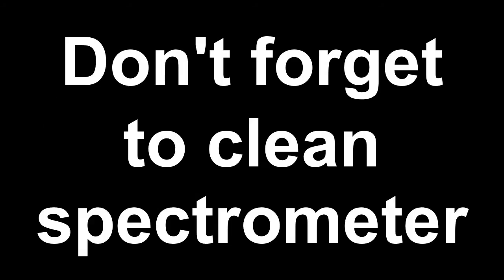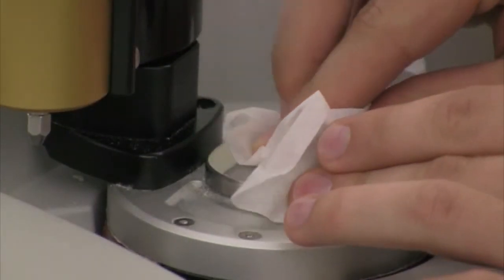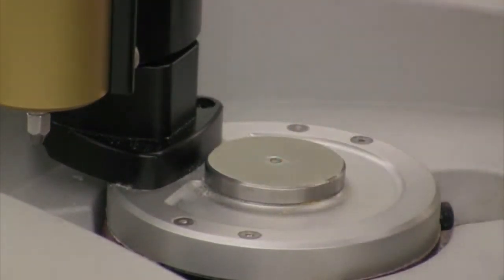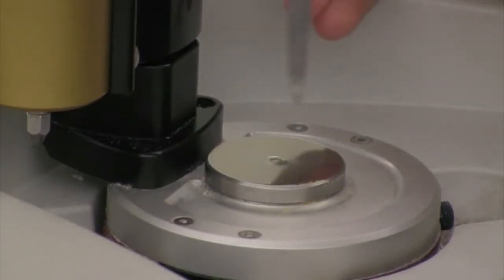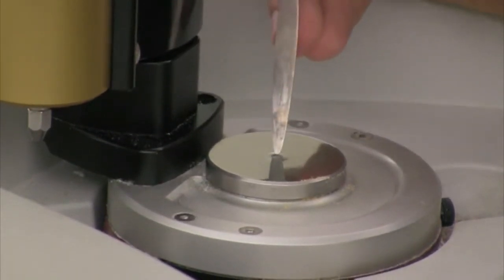Then the last thing you have to do before you leave is clean your sample off of the diamond. So the easiest way to clean your sample off the diamond is to simply take a Kim wipe and wipe your sample off the diamond. That's easier to do with liquids than solids. If you have a solid and that solid was pressed up hard against the surface of the diamond, you might want to use a microspatula, kind of like an ice scraper blade on a windshield, to scrape the material off the surface of the diamond.